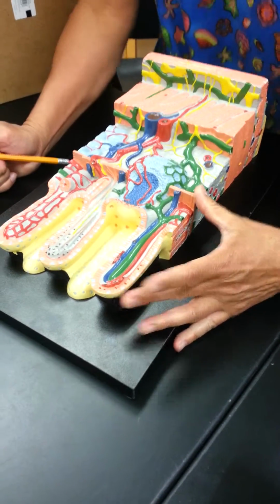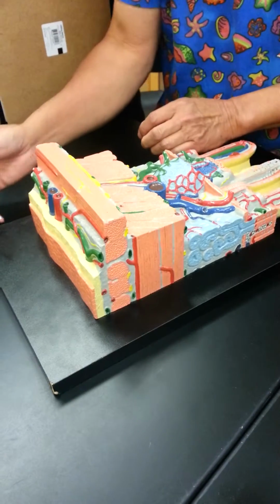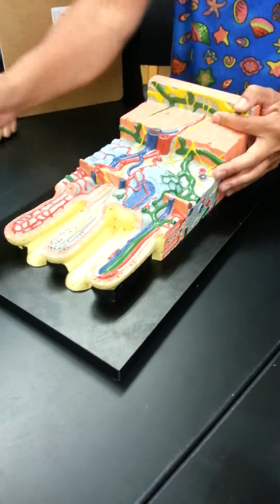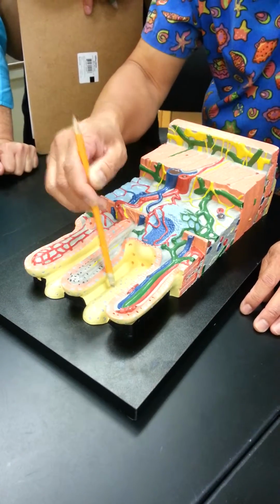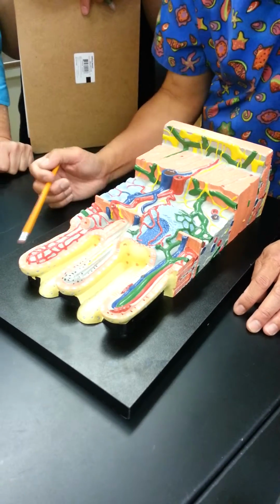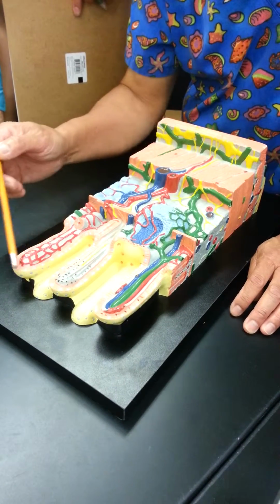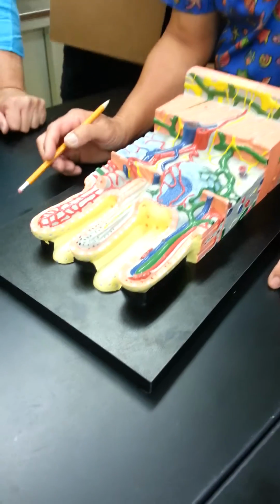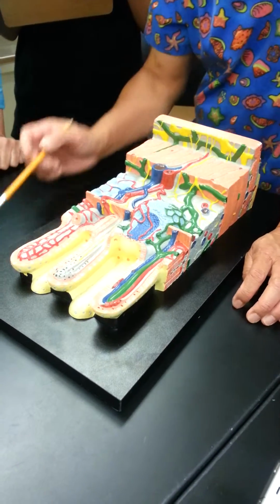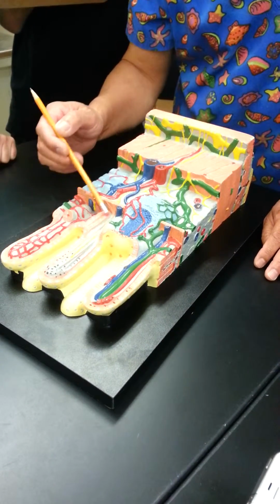Mucosa. Okay. Submucosa, muscularis externa, and this is serosa, or visceral peritoneum. Lumen is up here. So these are folds of the mucosa that we have called villi. Okay. So, all the pink are the simple columnar cells, and the ones with the blue dots represent the goblet cells, and the blue is the mucin. So the blue is mucin. Right?